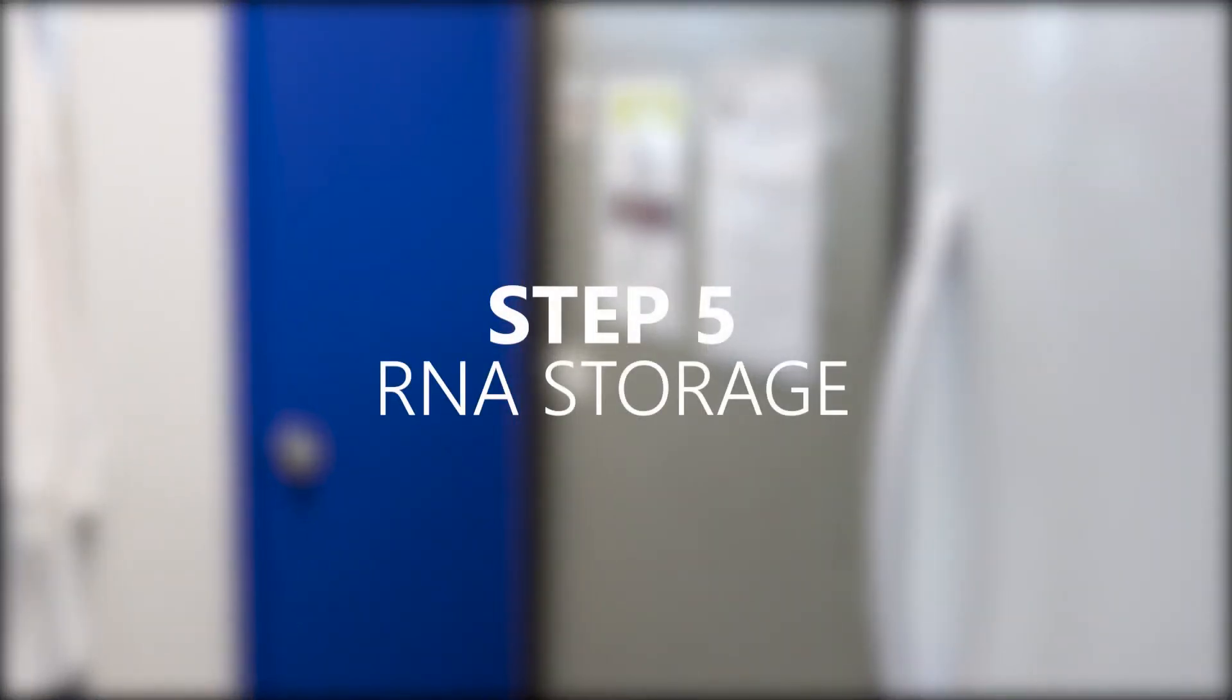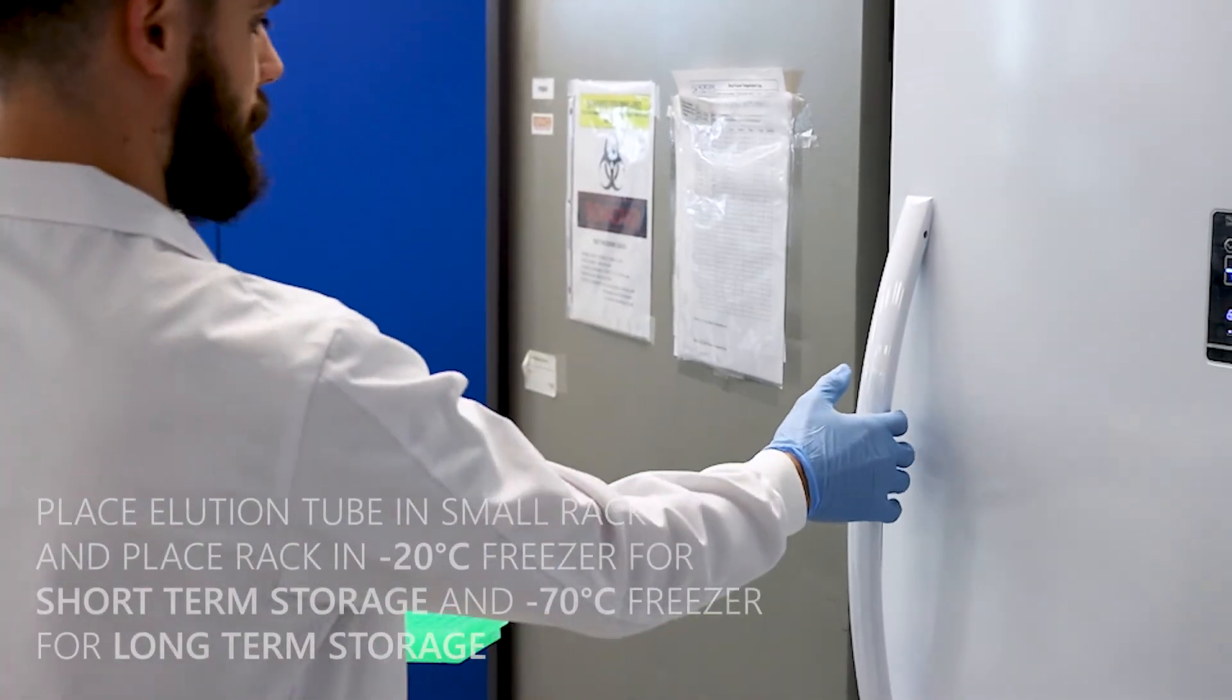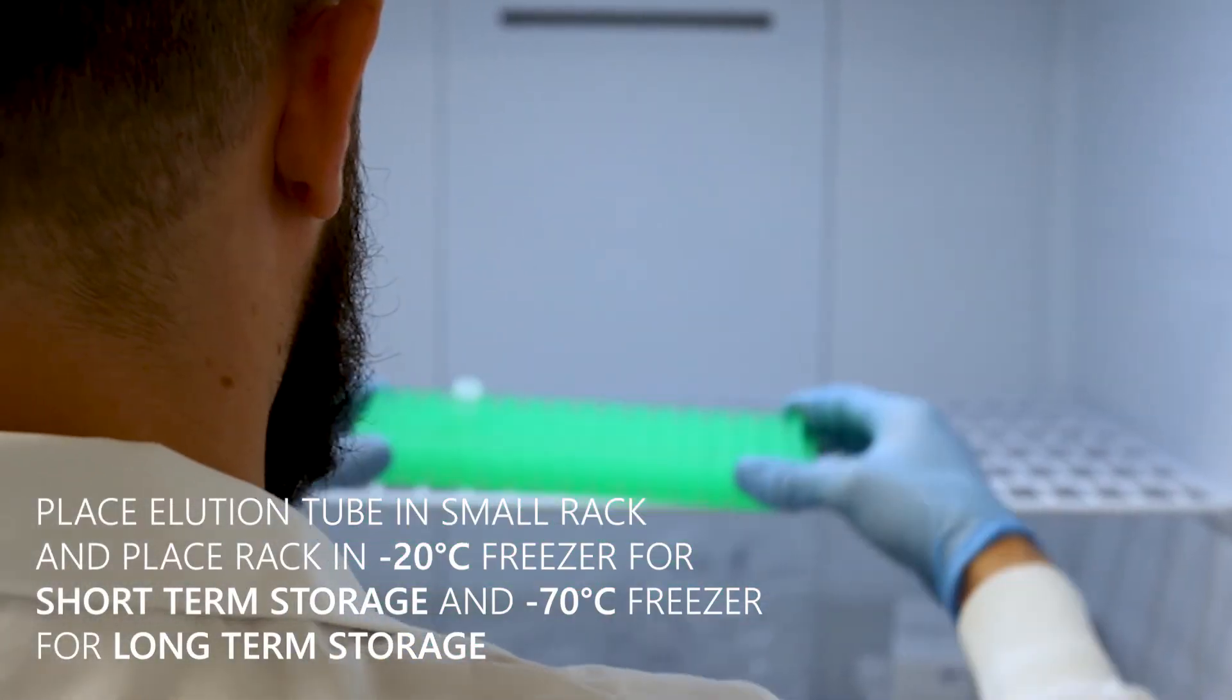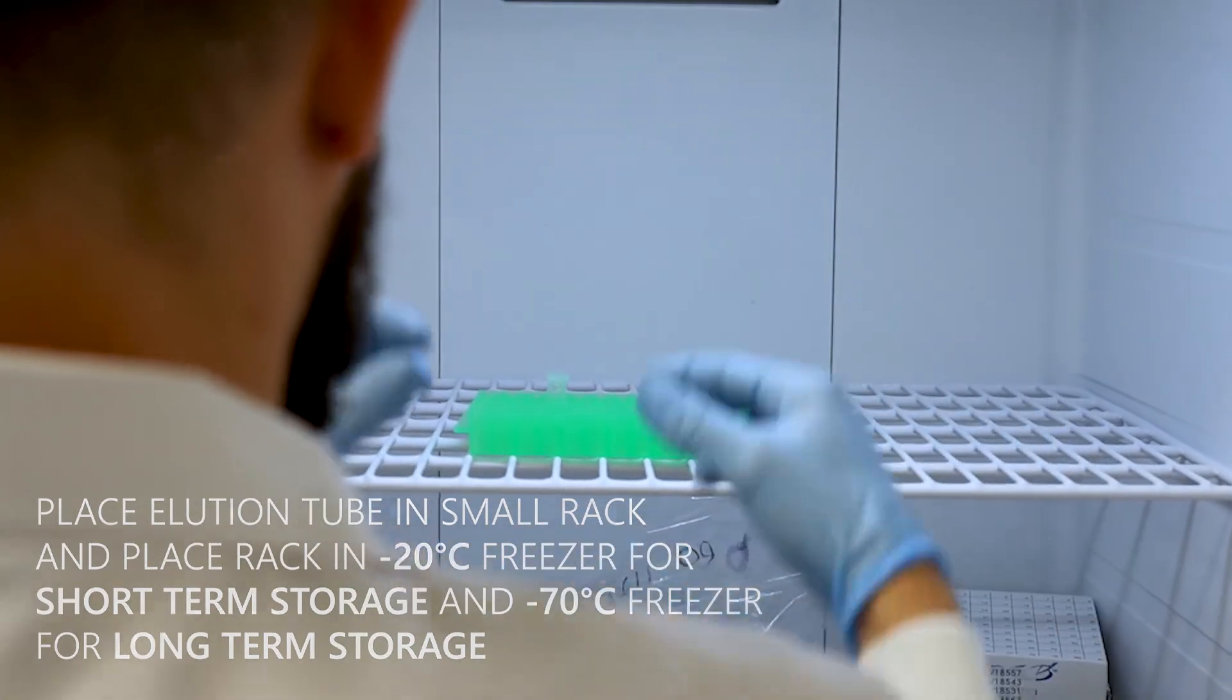Step 5. RNA Storage. RNA samples can now be stored at minus 20 degrees for short-term storage and at minus 70 degrees for long-term storage.